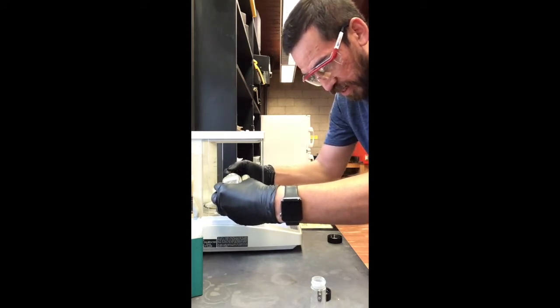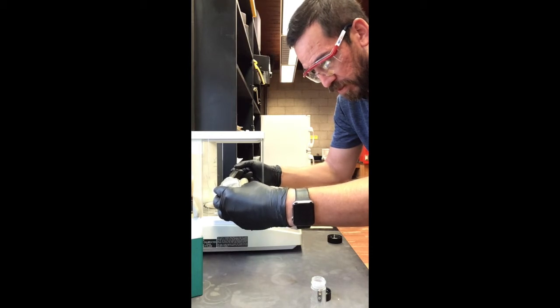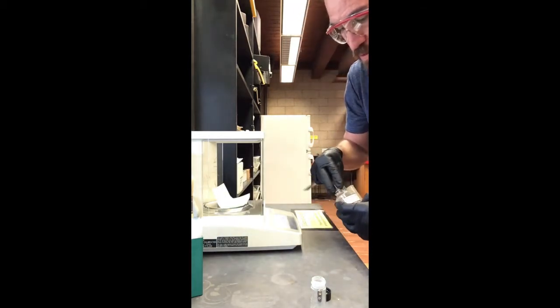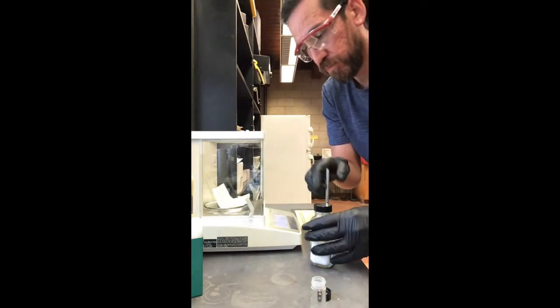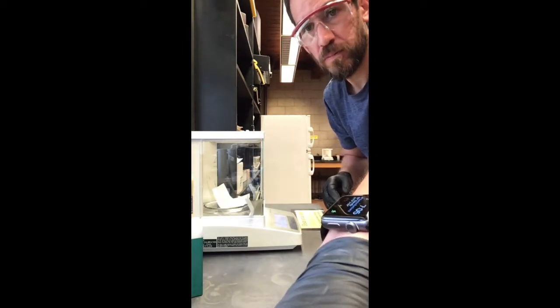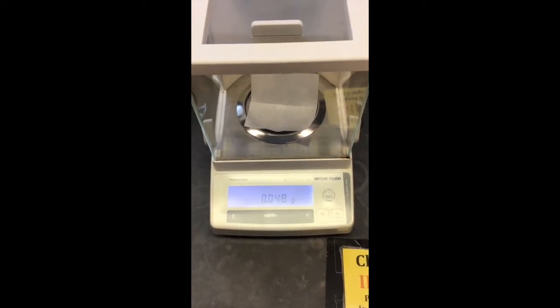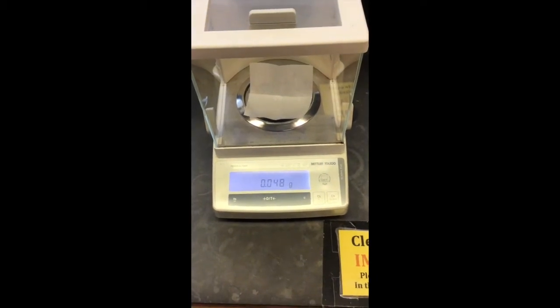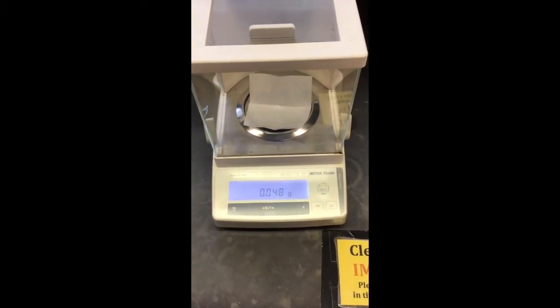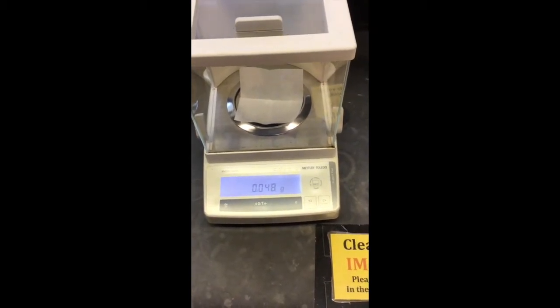That's 39 milligrams, so I'll add a little bit more. We've got 0.048 grams, which is very close to the 0.050 grams the procedure calls for. Make sure you record that value because we'll use it for our calculations — we won't be using 50 milligrams, we'll be using 48 milligrams.